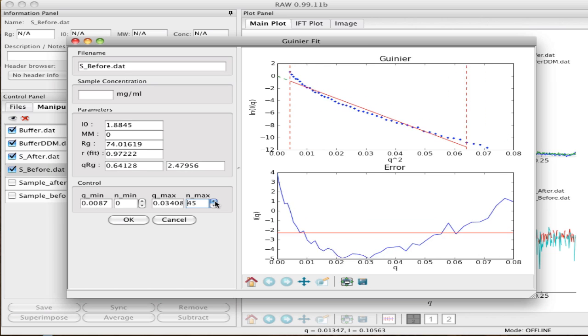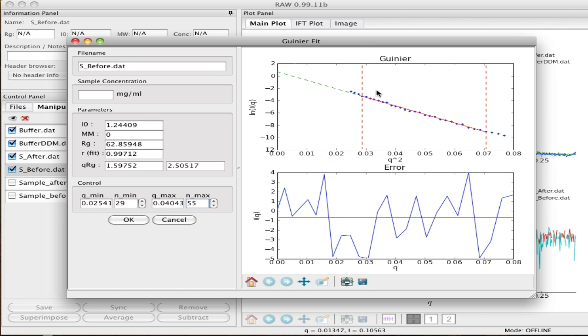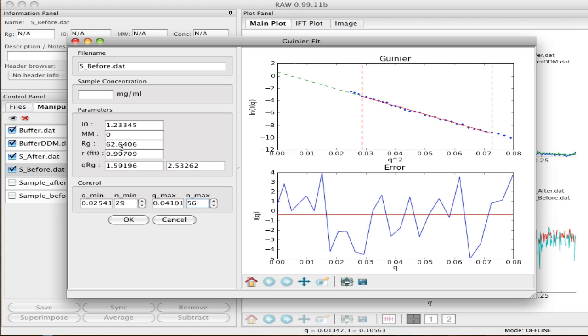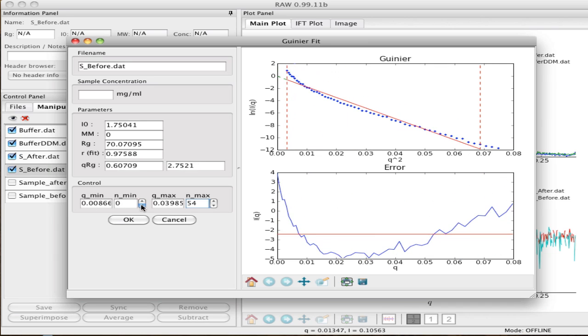Now you could attempt to extract a Guinier fit from this flat region here, and you almost get the right answer doing that. You'll notice it actually looks half decent, but your qRg is just ridiculously high, and you can try to bring it in, but you can never get it in there. It turns out that the Rg is rather close to 62, as you'll see in a moment. So that's really what's going on here: you've got some large junk in the mix that is messing up your Guinier plot, and you see it almost flatten out and then charge upward. So I'm going to get rid of this one.